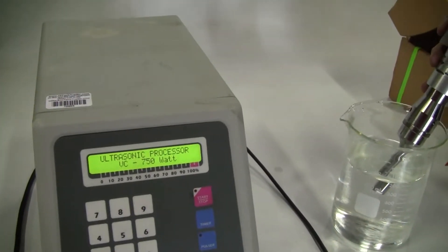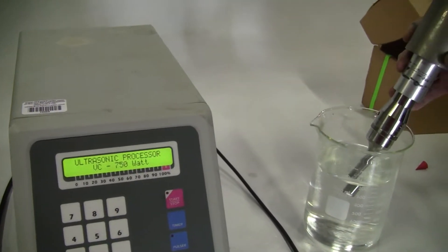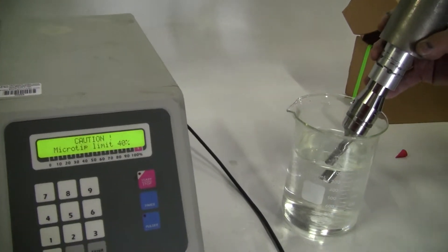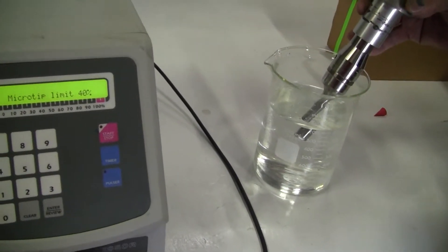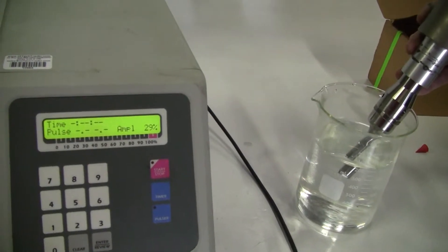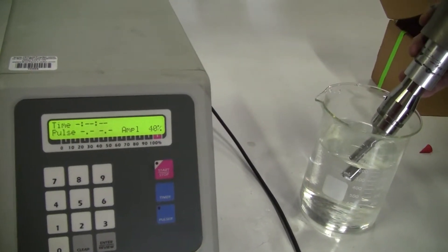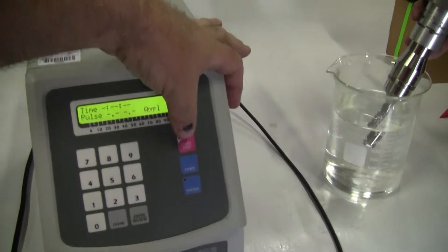Put it on. A little warm up for a second. Okay, let's start it up.